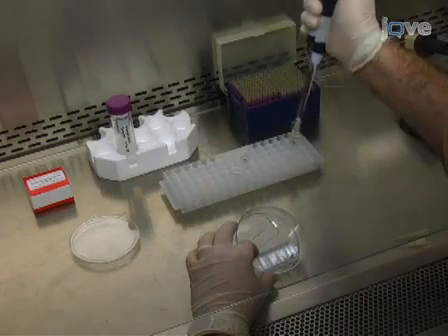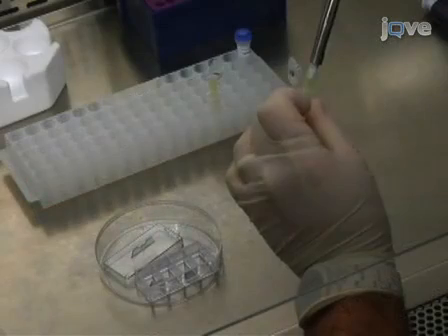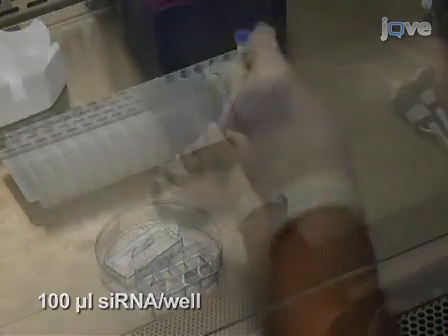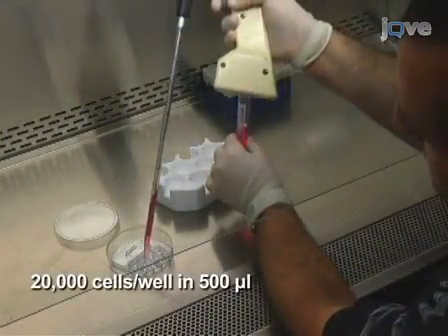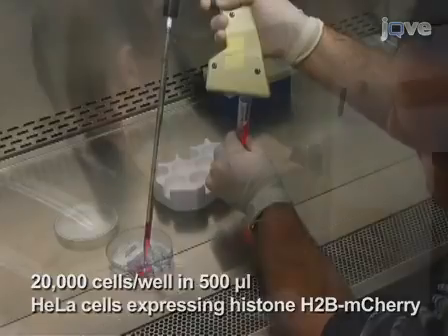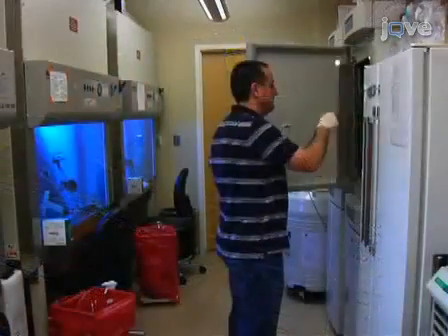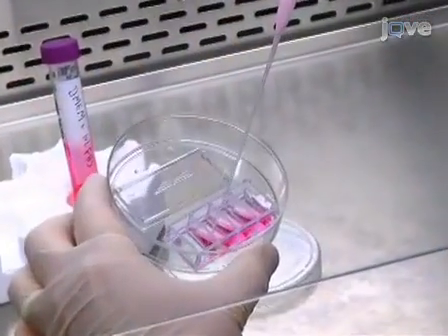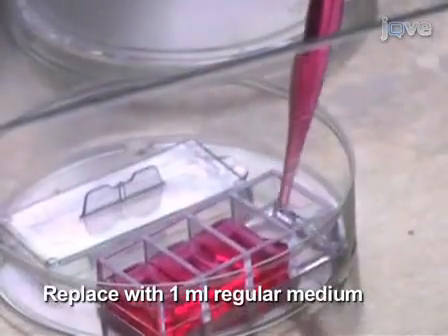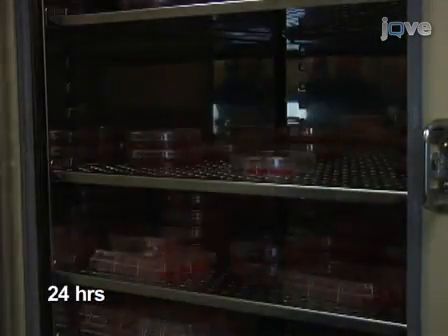After 15 minutes, remove the fibronectin from the wells of the chambered cover glass. Then, add 100 microliters of siRNA complexes to each well. Aliquot 20,000 cells in 500 microliters to each well. Place the cells in the incubator for 24 hours. The next day, replace the transfection mixture with 1 milliliter of regular cell culture medium. Then, incubate cells an additional 24 hours before image acquisition.